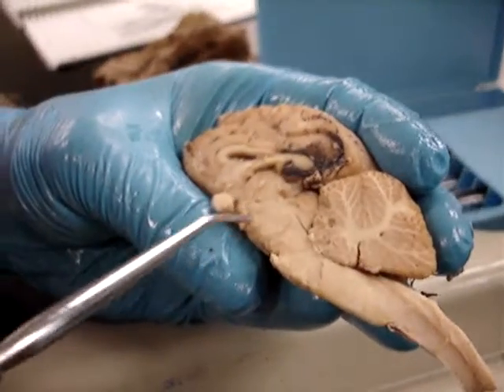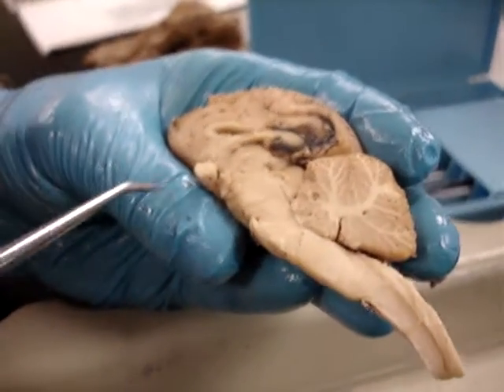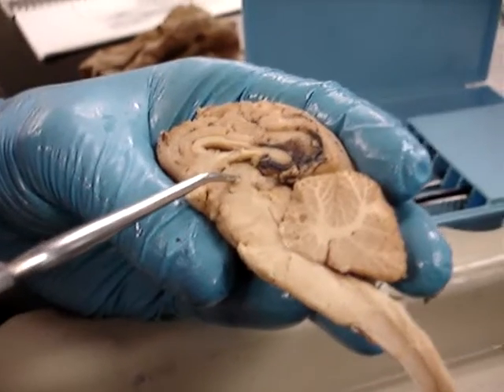You have your superior and inferior colliculus. This is the massa intermedia.